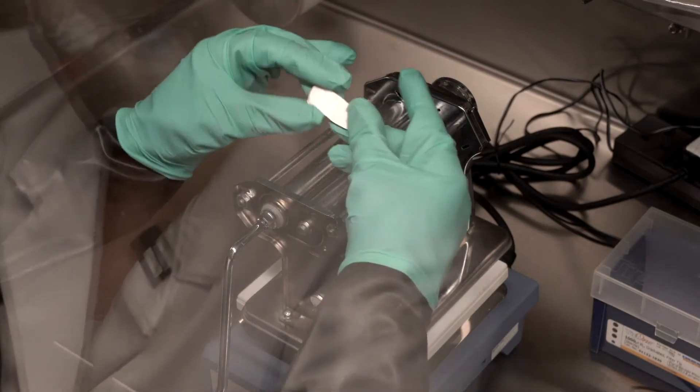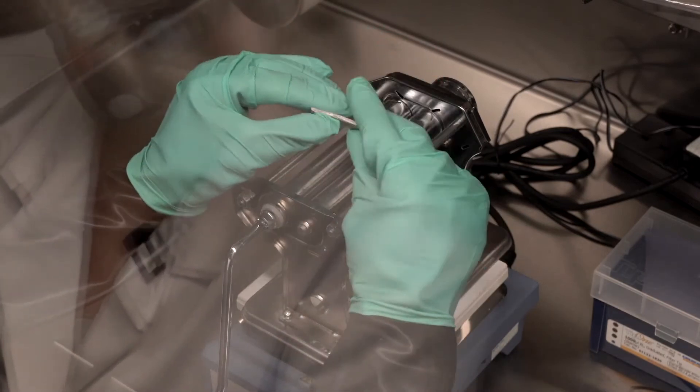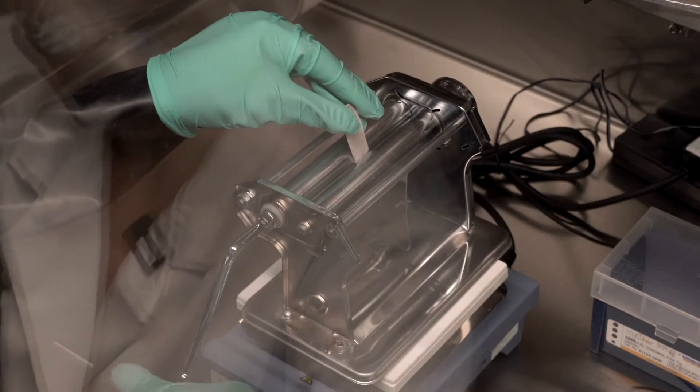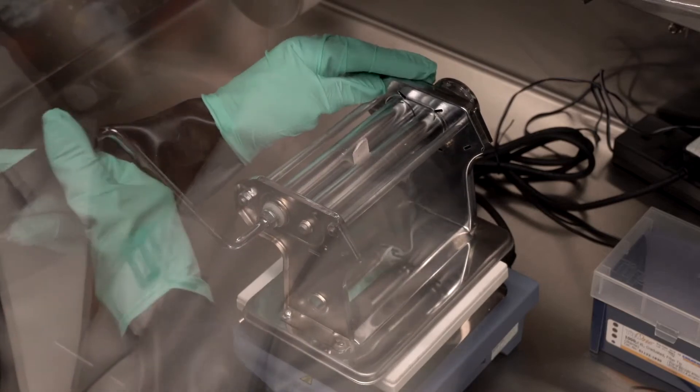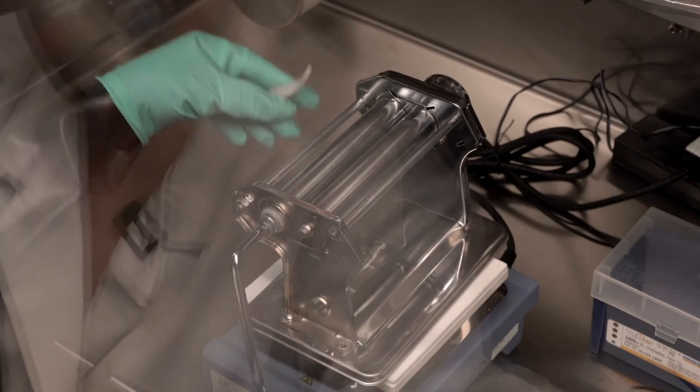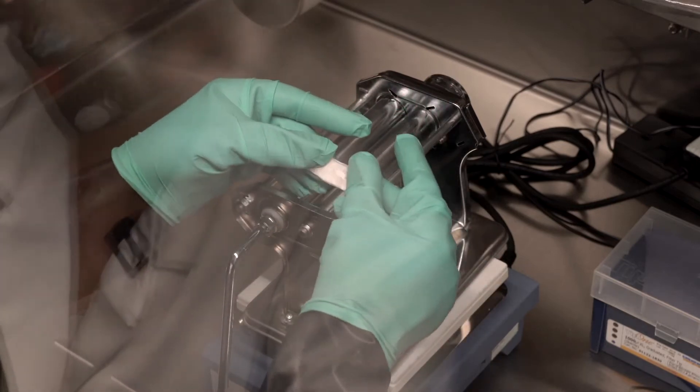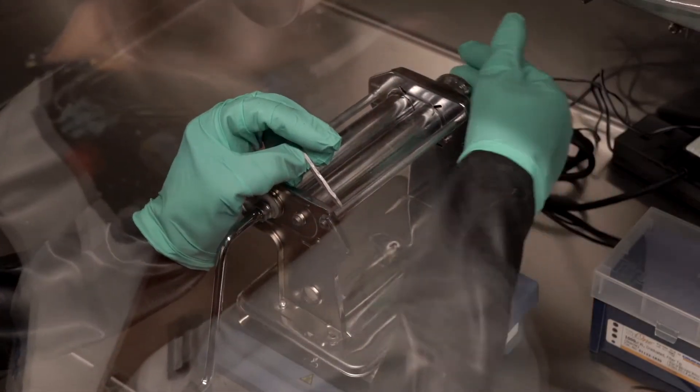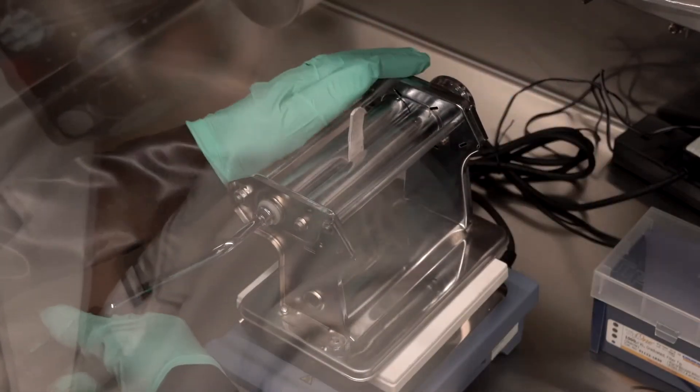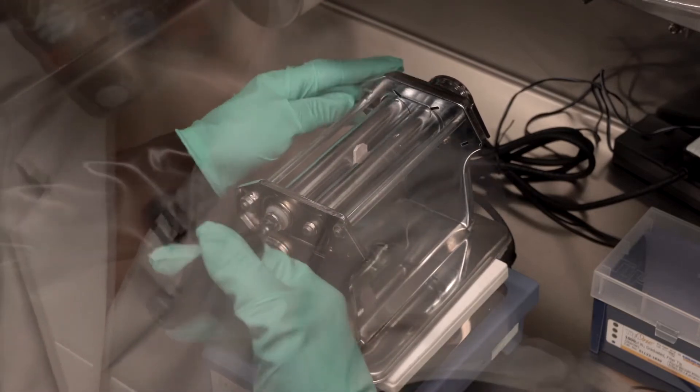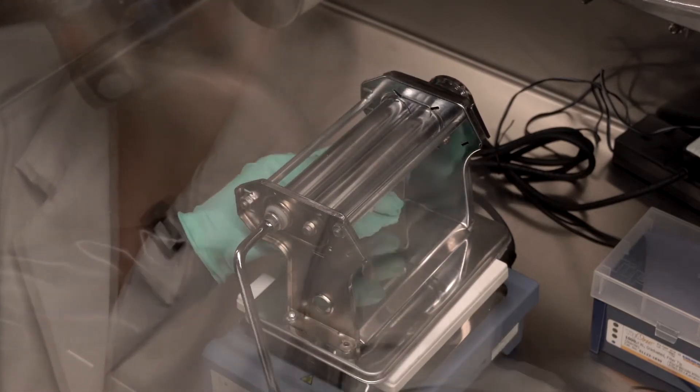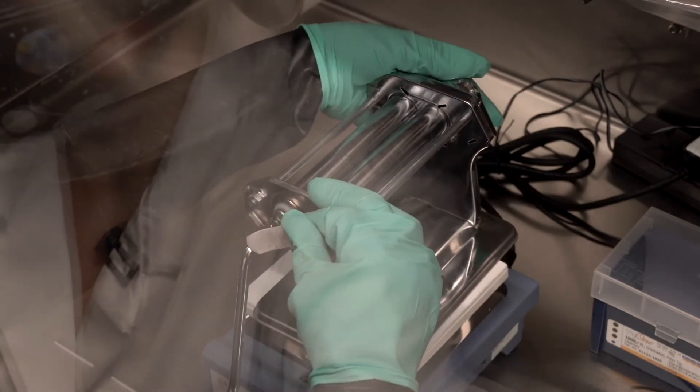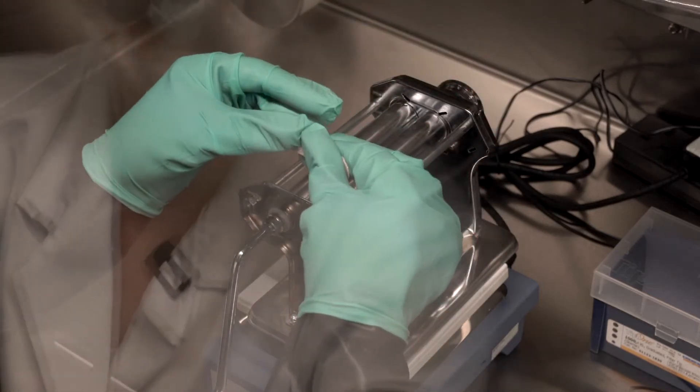Now, as I do this, you'll see the shimmer increase as the surface is pulled and stretched. I only use this pasta press for my sodium metal. The first few are very easy. Then as the gap size narrows, you will see that the sodium metal starts to stick a bit to the rollers. And there are a few ways of mitigating that.